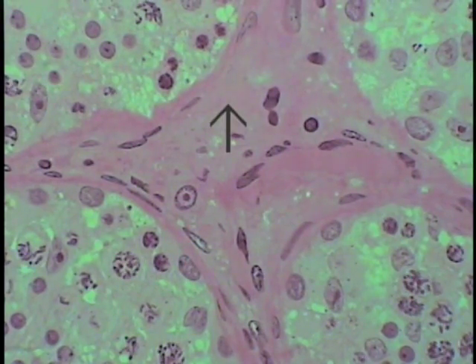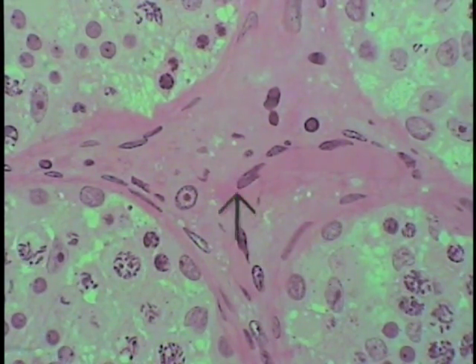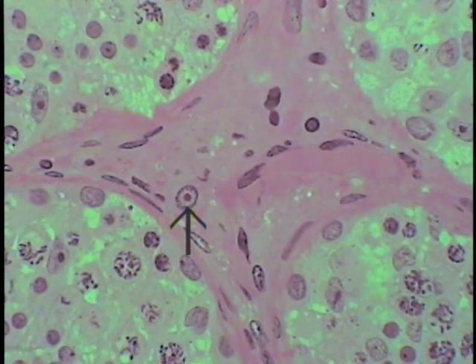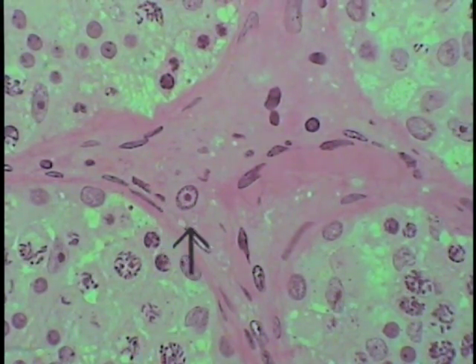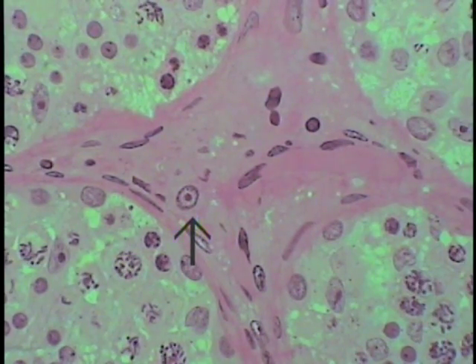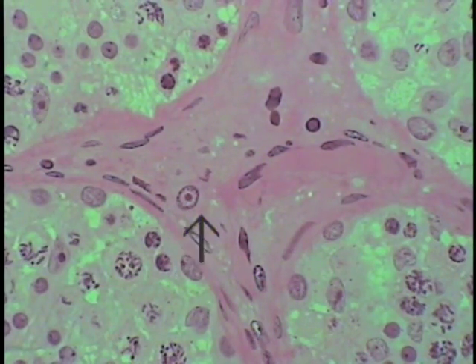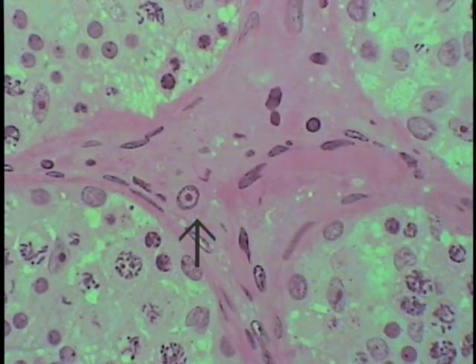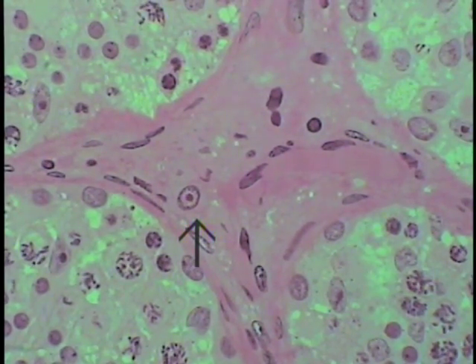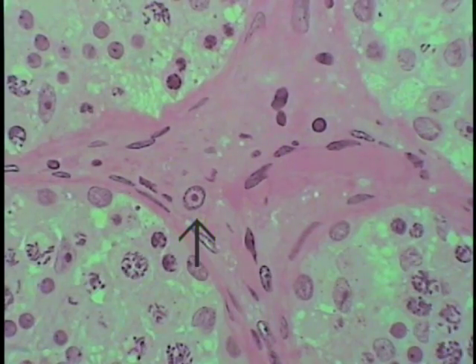A field of the intervening interstitial tissue between profiles from four seminiferous tubules illustrates a Leydig cell. The nucleus of the Leydig cell shows a very distinct nucleolus, and its cytoplasm extends as traced by the pointer. Remember, the Leydig cell is the cell type producing testosterone, the male hormone, and it is under the control of interstitial cell stimulating hormone — equivalent to LH in the female system.